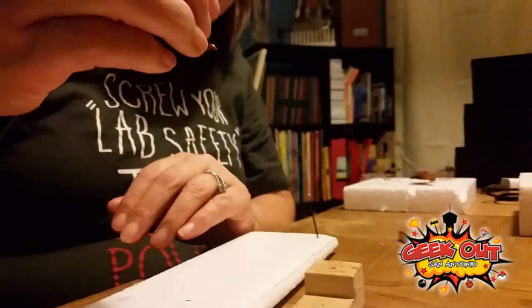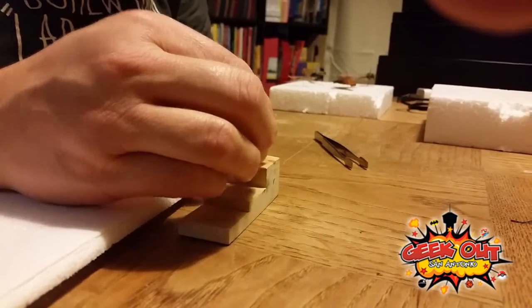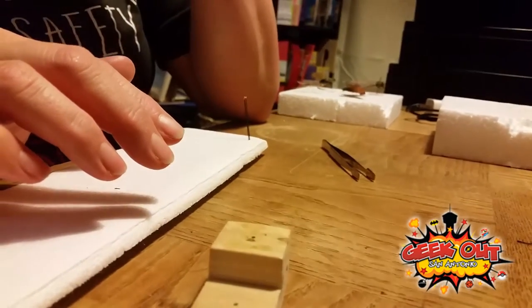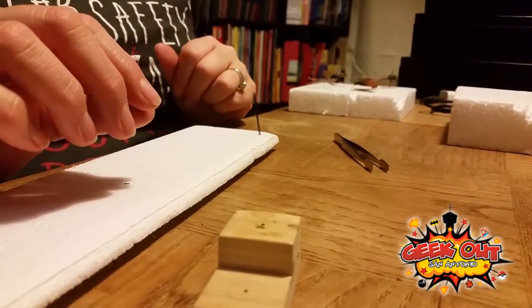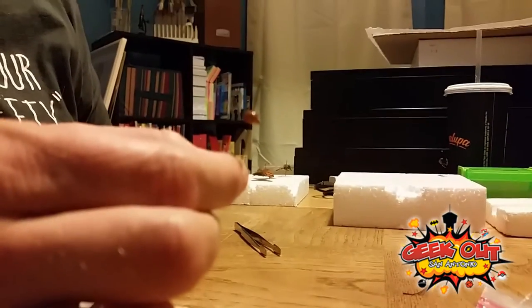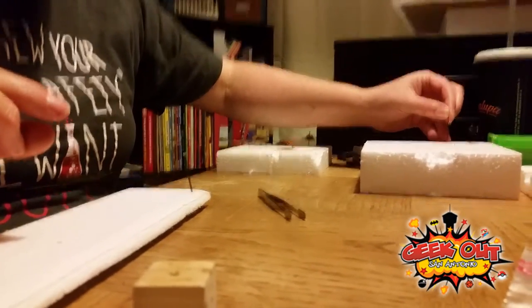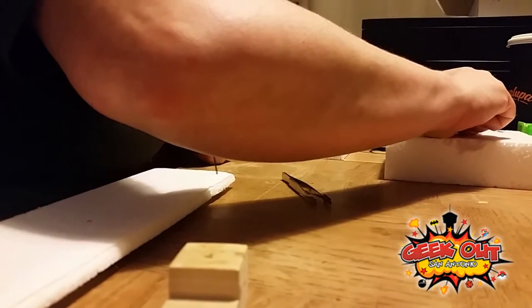This one is recently dead, so it's probably squishier than the wasp was. I feel like her wings are just going to come right off — that can happen to insects, so be really careful. The more you move her around, the more that wing is going to come loose. She's a ladybug, so they're not very sturdy. It'll dry and it'll either fix itself or stay like that forever — either way, it's a ladybug; we can go outside and catch a hundred more.